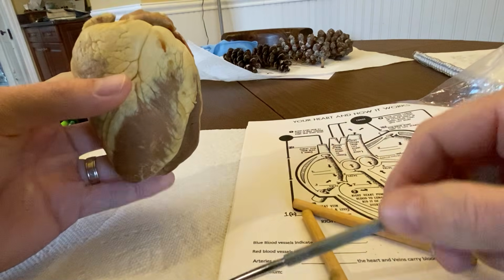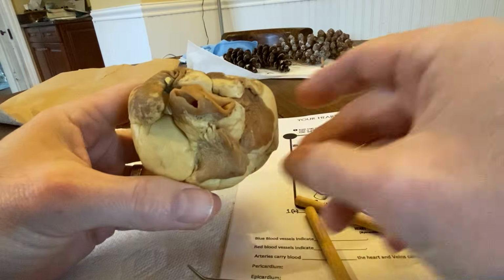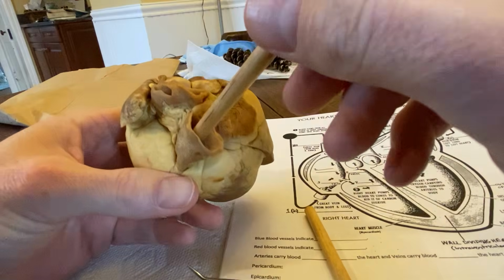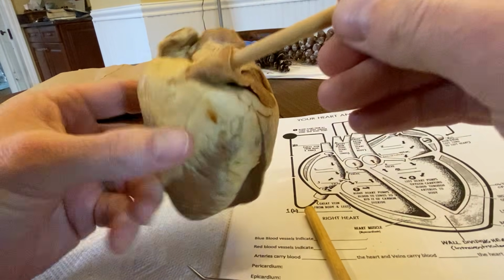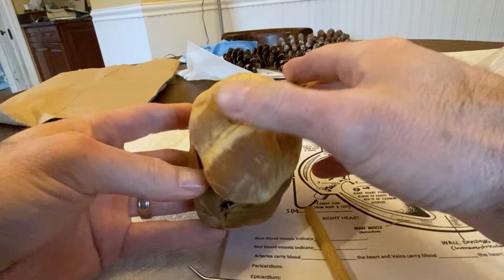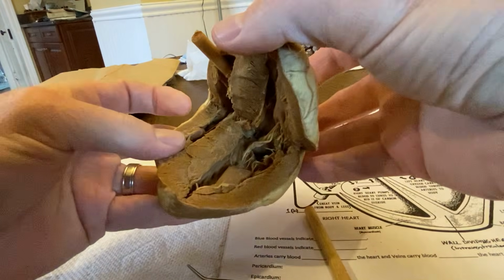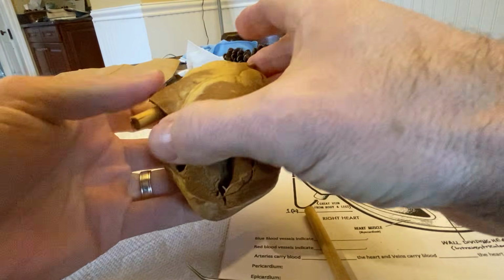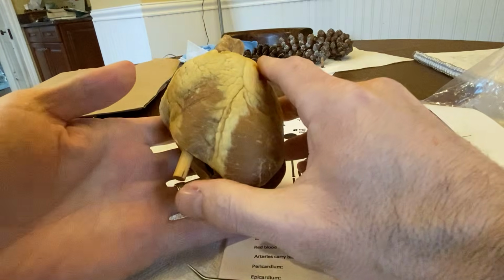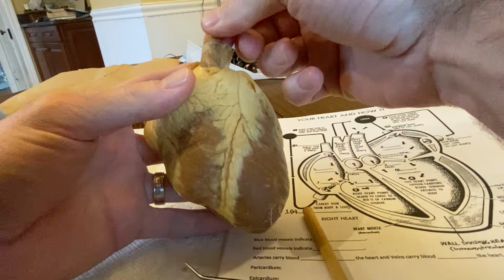The blood vessels are most easily seen if we look at it from the top here. So I'm going to angle it this way. And from the top, you'll see an opening right here, which kind of hides because it gets squished flat. This is going to be the pulmonary artery. And I know this is the pulmonary artery because if I check where this wooden dowel comes out, it comes out into our right ventricle. Remember, the right ventricle is going to squeeze the blood up and out the pulmonary artery. So that's where this blood would be going.